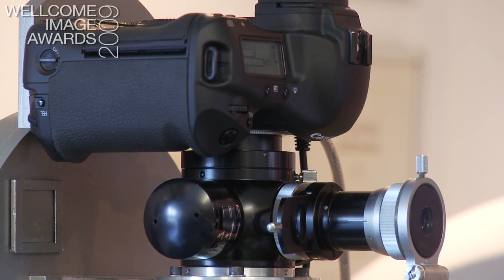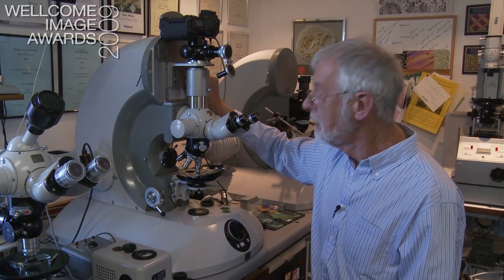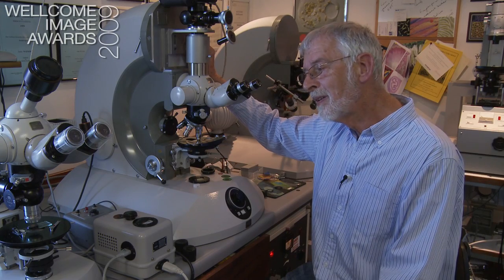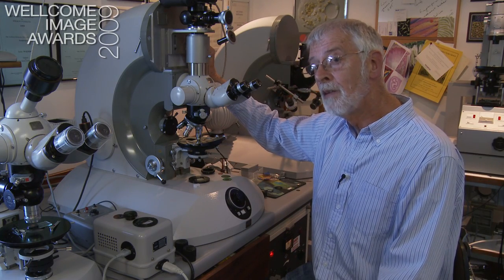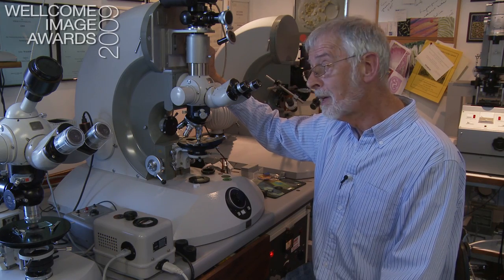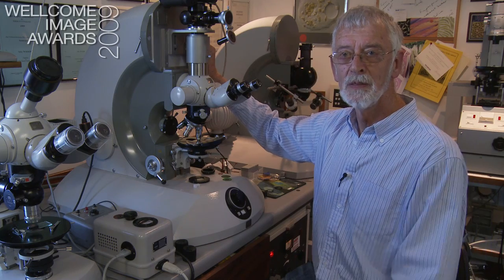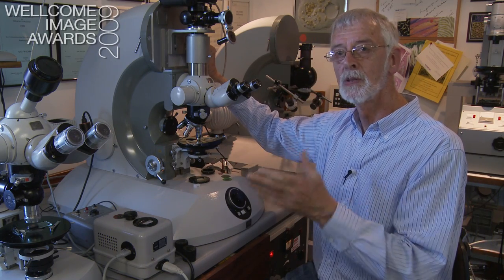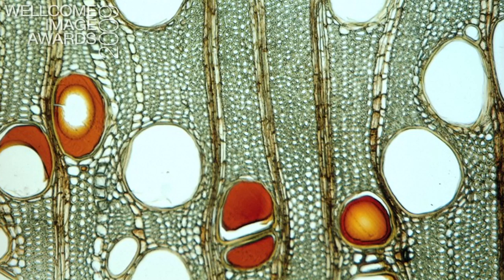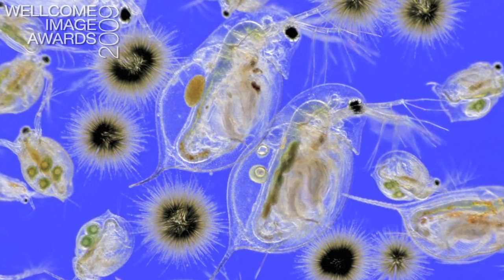We've got a camera anchored on this very substantial bracket here to reduce vibration. But contrary to what you might think, you need very long exposures, not very short ones. By having a very long exposure, you lose the first half second while the camera's waving about, and then most of the exposure is where everything is still, and then it shuts at the end. So usually four or six second exposures on this.